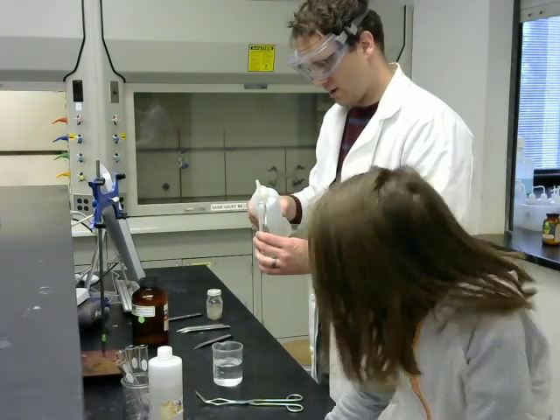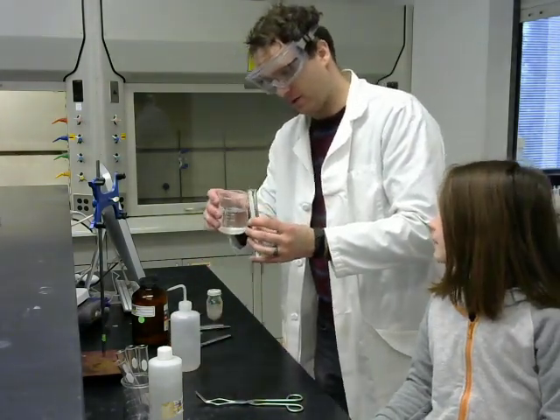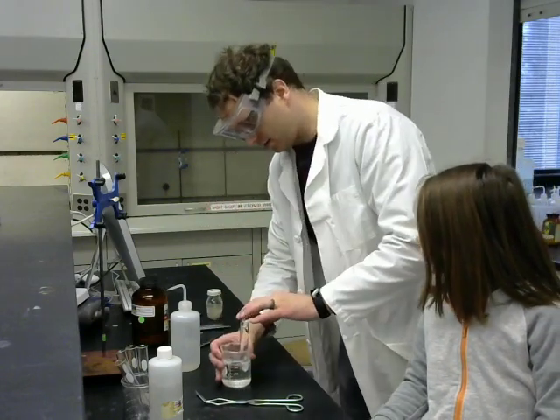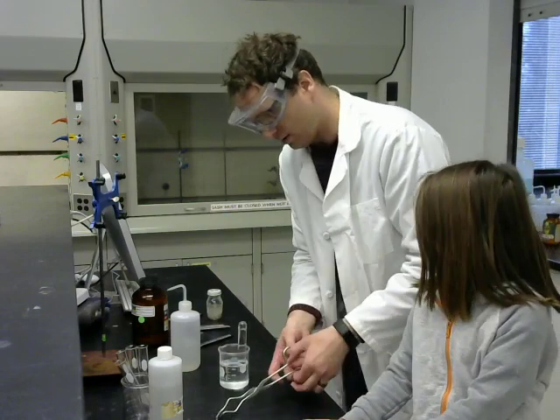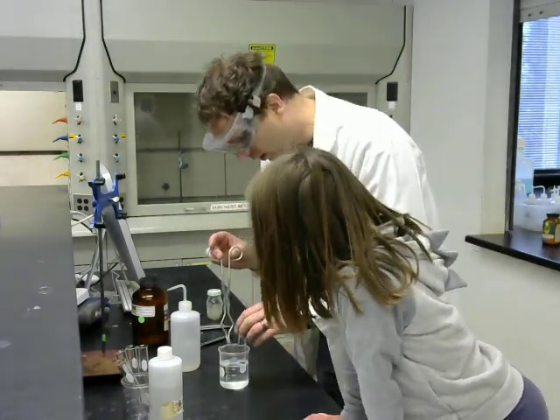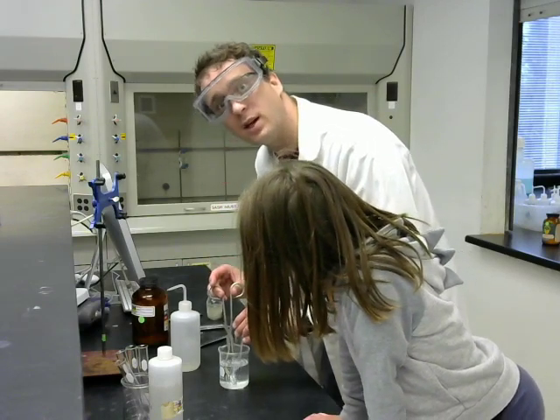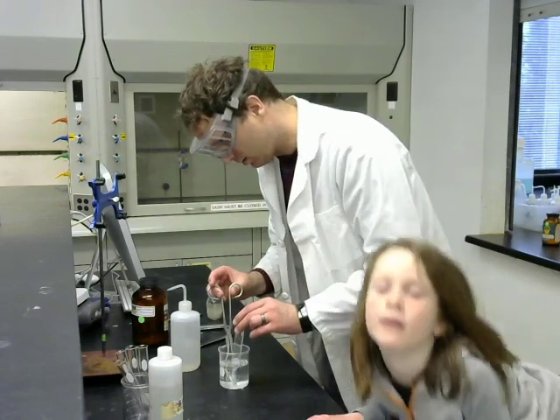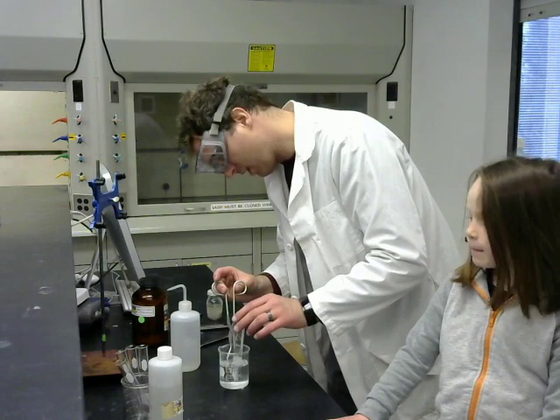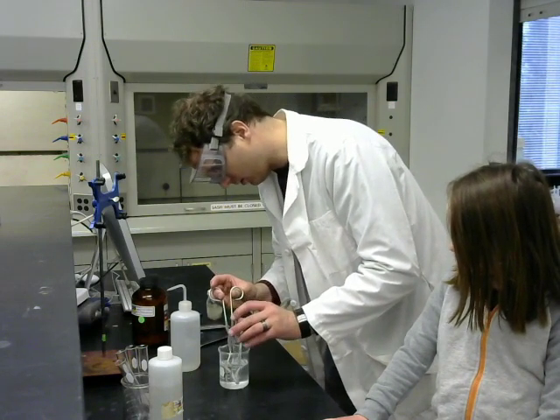Okay, so I've filled this with water, but remember the beaker is full of 1 molar acid. So we'll invert it and put the magnesium metal in underneath the beaker. Okay. And Tina, can you move your head? Actually, the students need to see. So it is bubbling vigorously. We're collecting those bubbles.